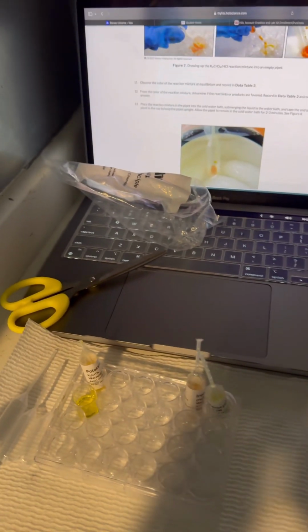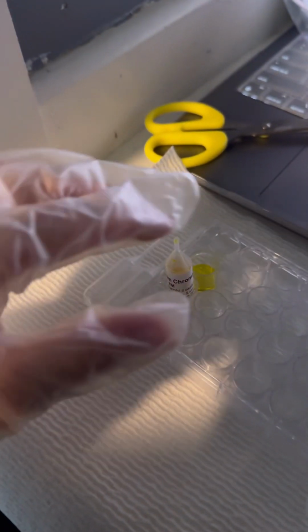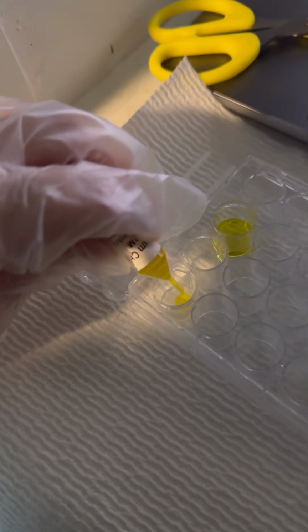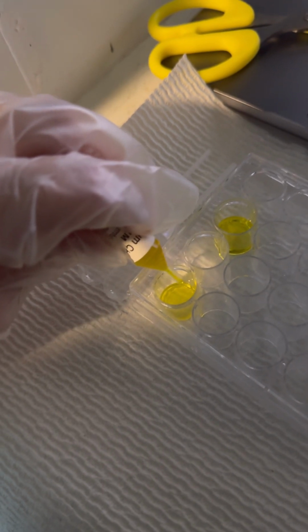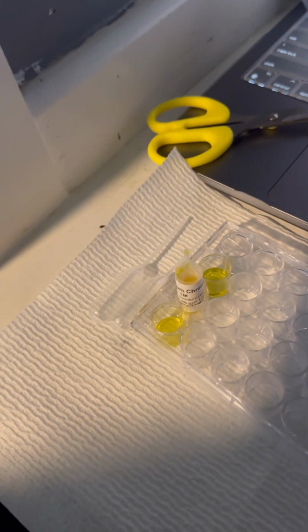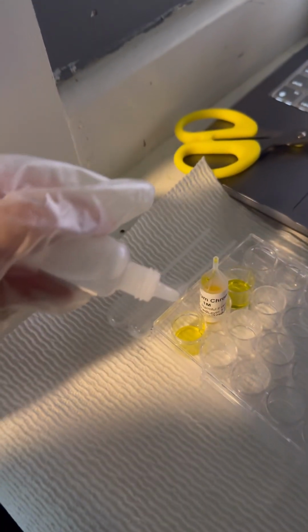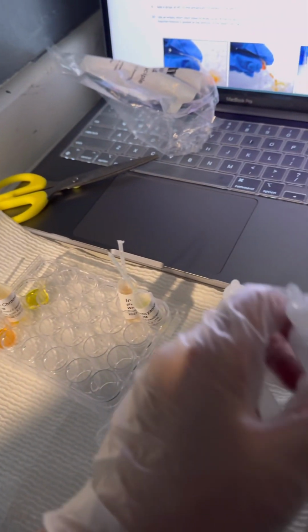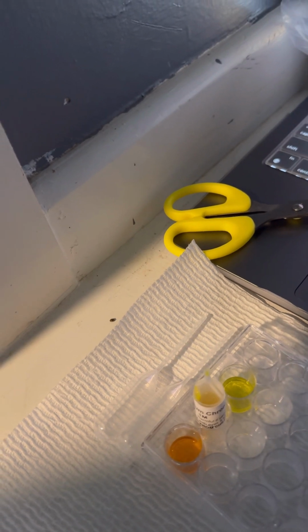So I'll begin the experiment. I'll place the 8 drops into the D1 well, so it'll be easier to suck up the mixture using the pipette. So 8 drops of potassium chromate. And then it says to add 4 drops of hydrochloric acid to the potassium chromate well. So hydrochloric acid, 4 drops. And it should turn into that bright orange color. And then it says to use the empty short stem pipette to draw up all the potassium chromate.